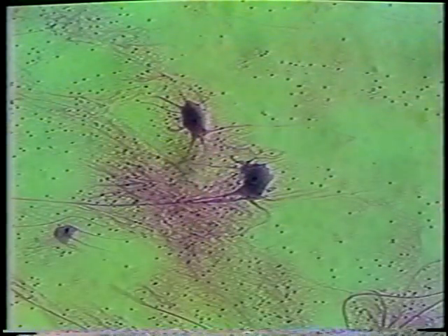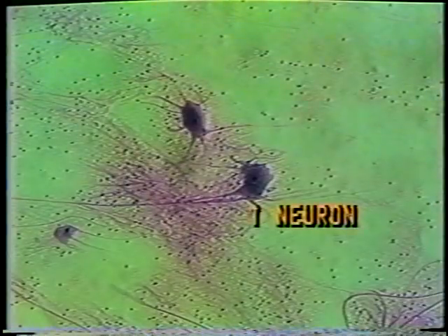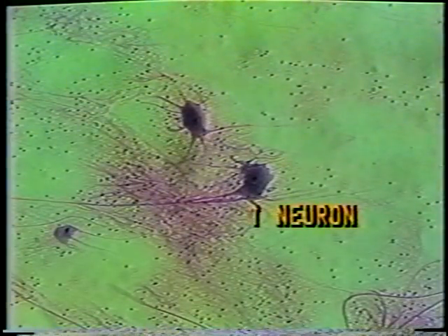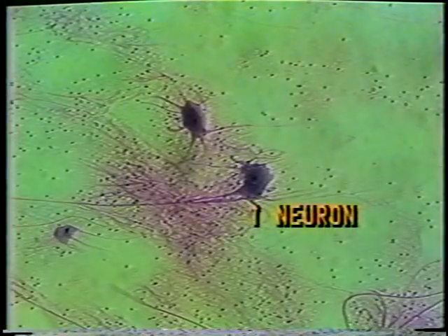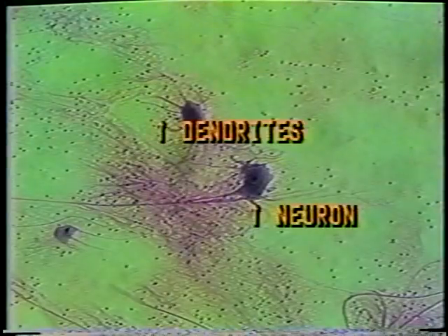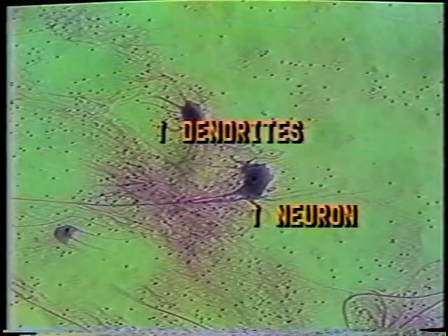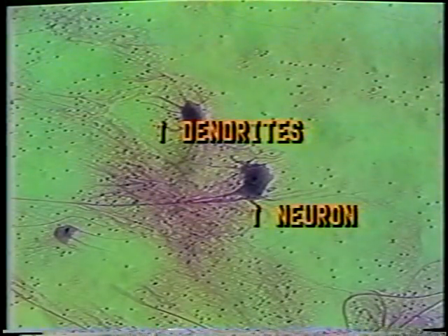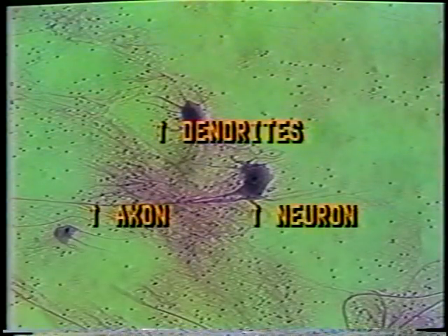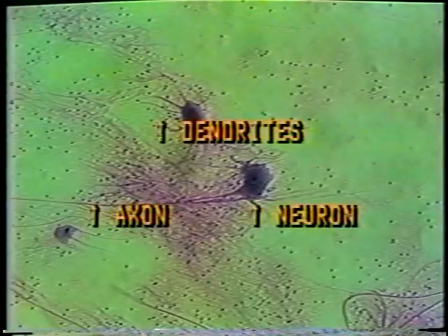Nerve tissue is composed of cells called neurons. This is a somatic motor neuron responsible for stimulating skeletal muscles. Each neuron may have one or more receiving processes called dendrites and a single sending process called an axon. One cannot always distinguish between axons and dendrites in a neuron structurally.